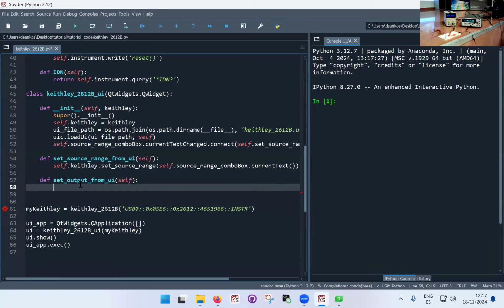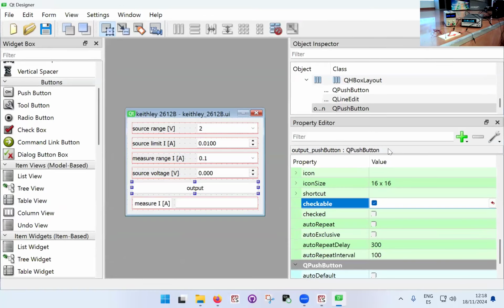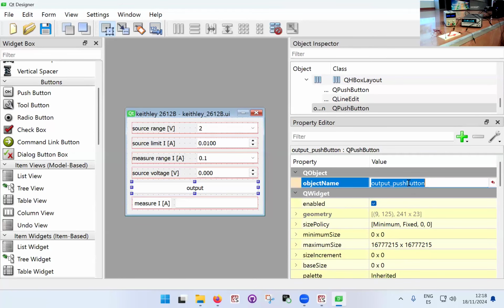So what we want to do is check the state of the button. We click the button, and we want to see if the button is in the on state or in the off state. If it's in the on state, we want to turn it off. If it's in the off state, we want to turn it on. That's what we want to happen visually. So we have to put an if-else statement. So if self dot, now we have to put the name of the button, which is output push button.